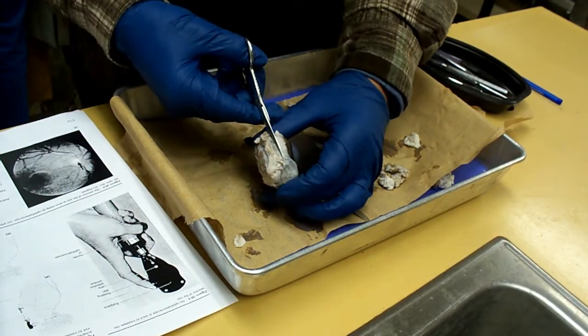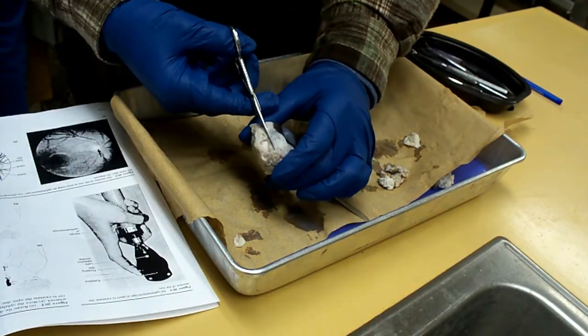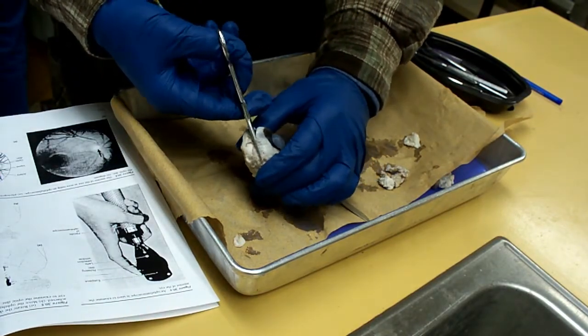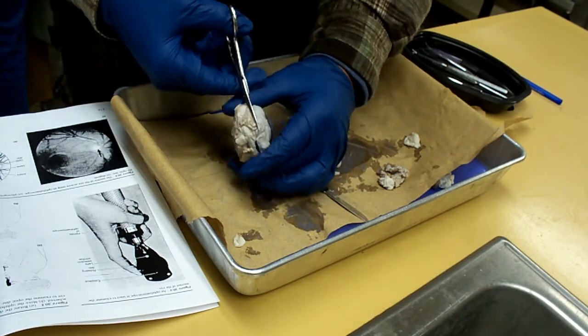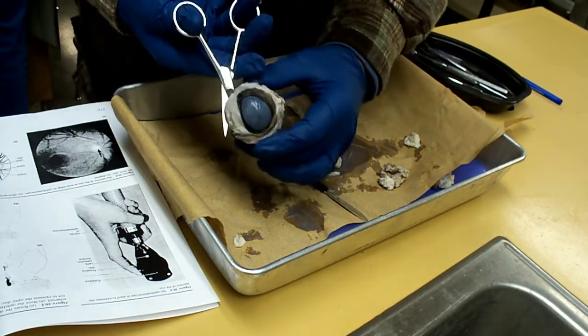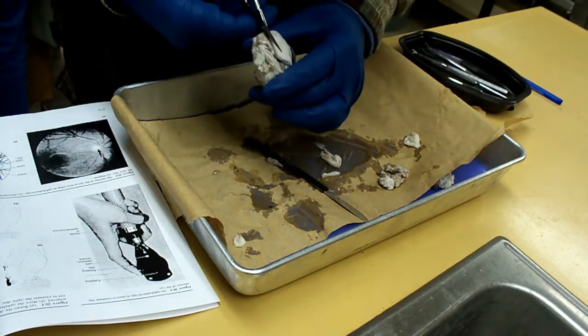He's got to squeeze. And then push it to see. Ewww. Did it squeeze? Oh, look at all that juice. You stab it right here. Ewww, look at all of that. Stripping out. Ewww. So like right here? Did you just poke it, poke the scissors? Where? Ewww, gross. Right about here, right in the middle.